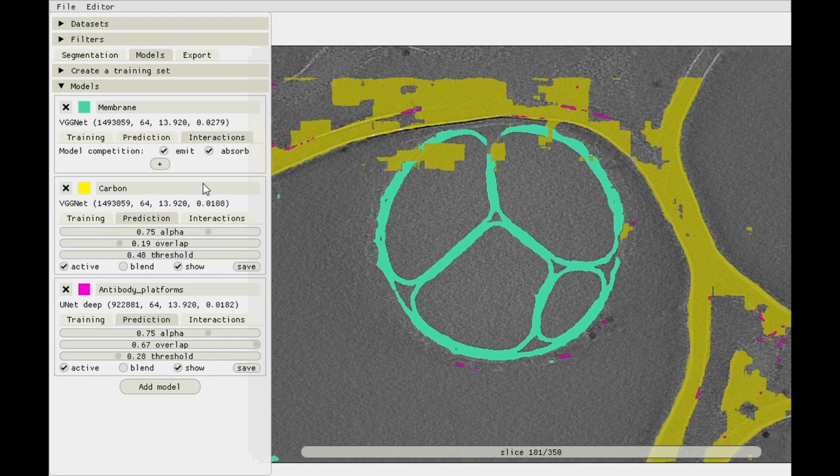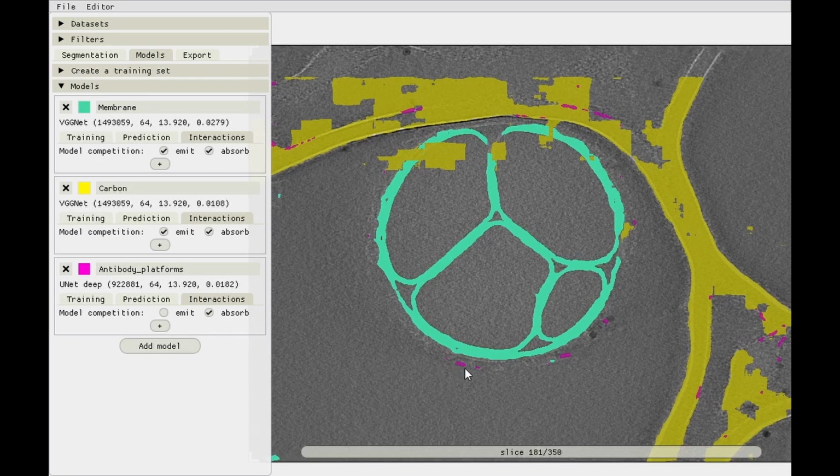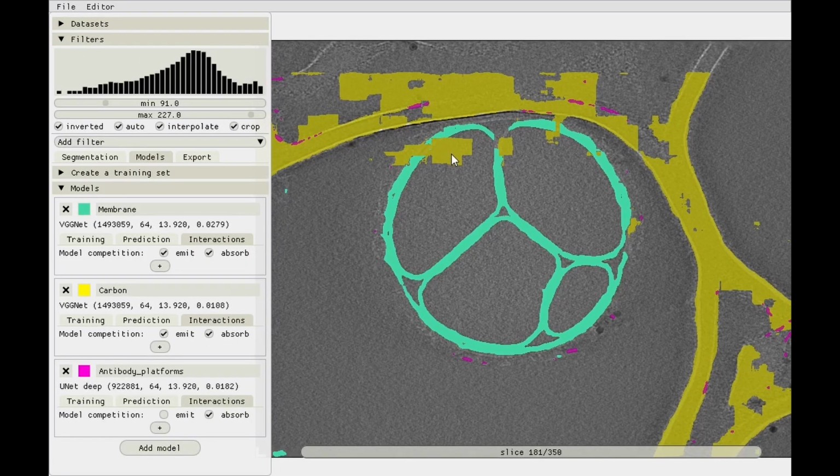First thing we'll try is to give model competition to the antibody platform model as well. So let's set it to absorb, but not to emit, because in those regions where it's correctly predicting antibodies, it's the only thing there, so we don't need to compete with carbon and membrane. But over here, the carbon is actually better. So by setting it to absorb the competition from the membrane and the carbon model, we should get rid of those predictions. Let's see if it actually works. There we go. So that's a start.